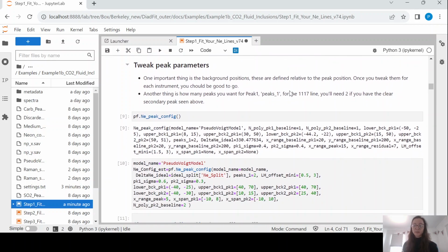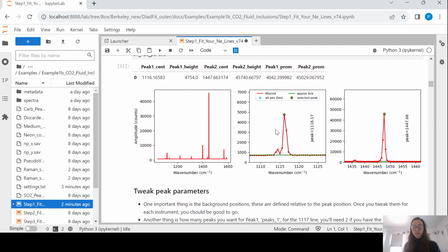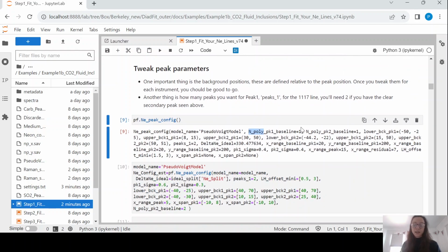Okay, so once you've got that and you tweak those parameters, the other things you're going to have to tweak is the actual peak fitting parameters itself. So what do we decide when we're fitting peaks? Well, firstly, we have to select background positions, and we have to fit a baseline between those backgrounds. So you can see here we are selecting the polynomial fit that we want to do for peak 1, which is the left-hand peak here. So we're saying we want to do a linear baseline basically, and the same for peak 2. We are expressing the background positions relative to the position of the peak. Okay, so this means that we want our background 50 units to the left and 25 units to the left of the first peak. So these default values are stored in this neon peak config function.